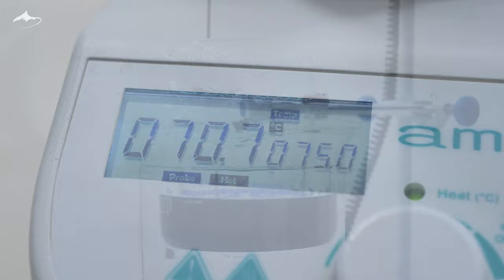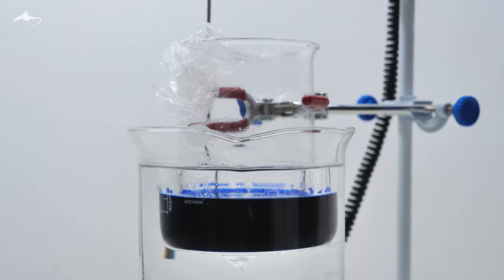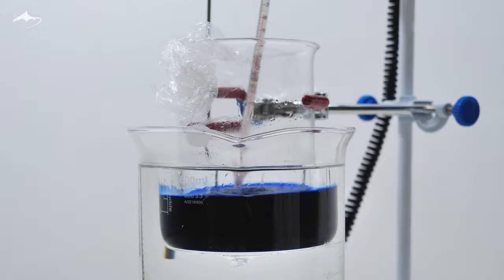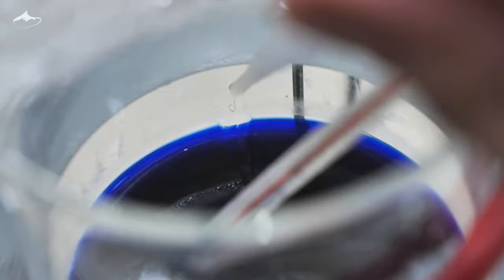So the smaller the extra volume, the less temperature needs to drop in order to start the formation of crystals. I then raised the temperature to 75 degrees celsius as liquid wasn't dark enough. I had to prepare more solvent as I ran out part way through. Here there was about 150 milliliters of liquid in the beaker and there was still undissolved salt.